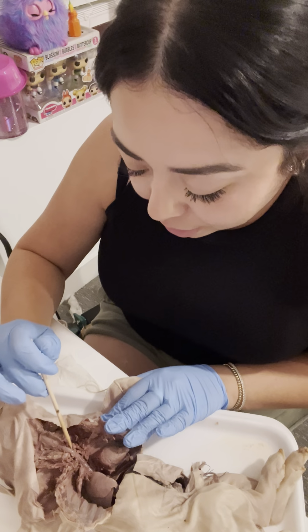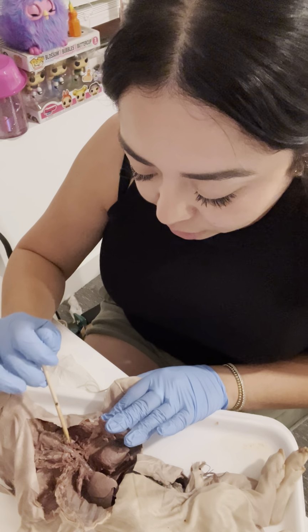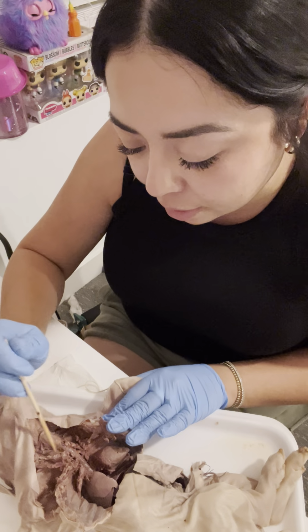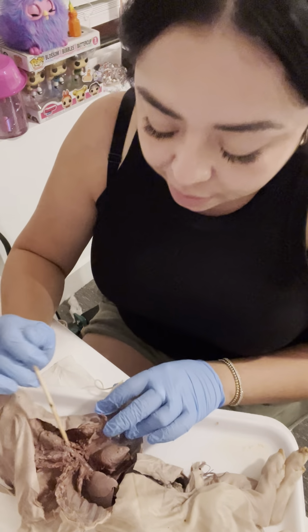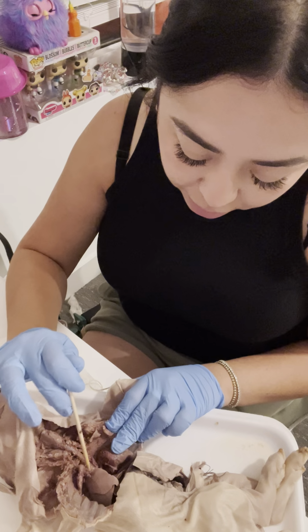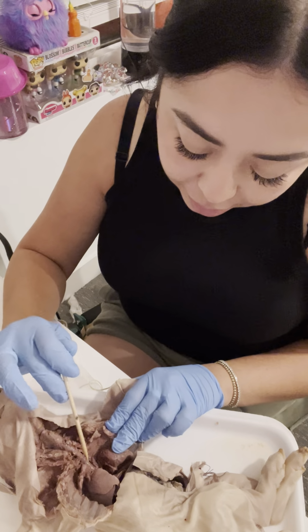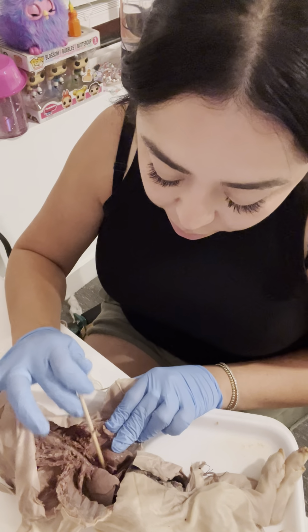and on this side, I think the last time I cut my thyroid gland, I think this is part of it here, but usually it goes over the trachea, and then we have the thymus on the sides. And then I'm gonna move the heart. It's kind of hard to see, but you can feel it. You can feel the right bronchi on this side, and then on the left side, you can feel the left bronchi.